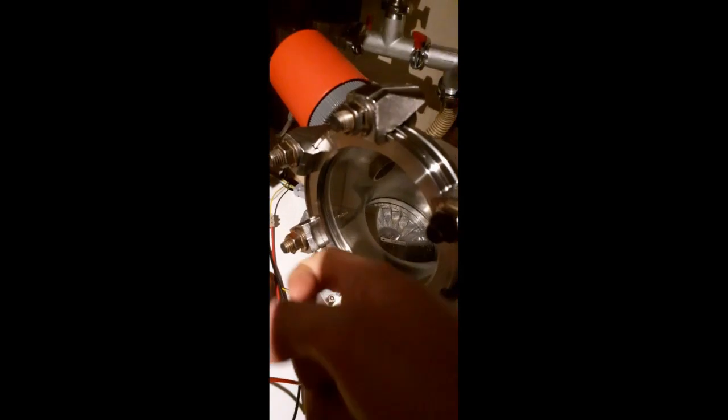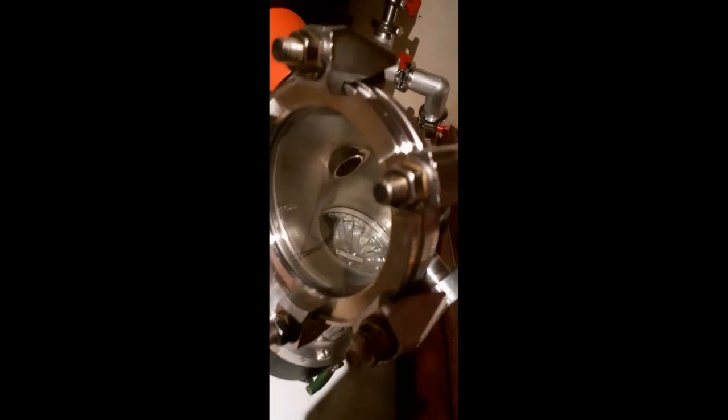And clamped to the front is a large, nice viewport, which might be Pyrex, might be quartz, might just be window glass. I have no idea. I got it on eBay, but it's glass at least. And that's nice, so you can monitor stuff in the chamber.